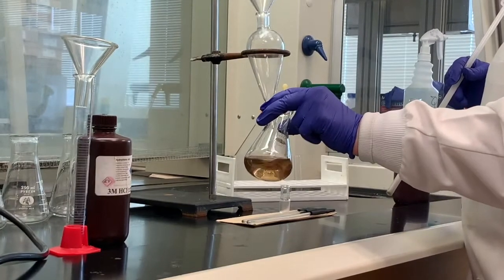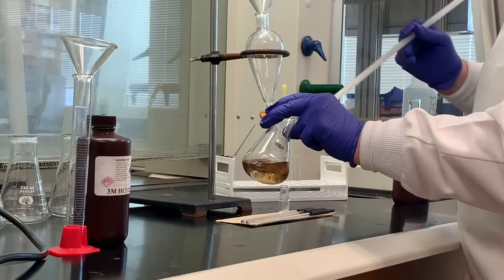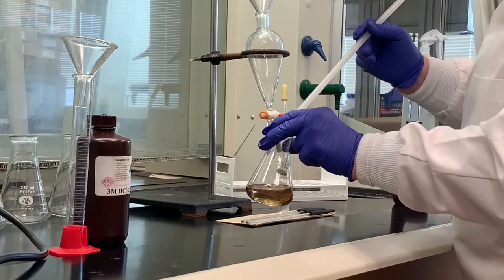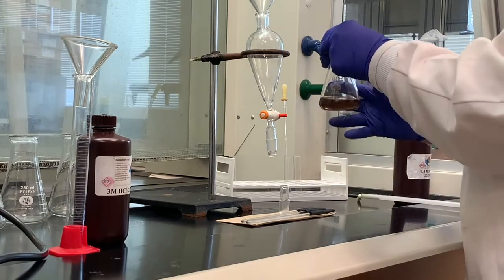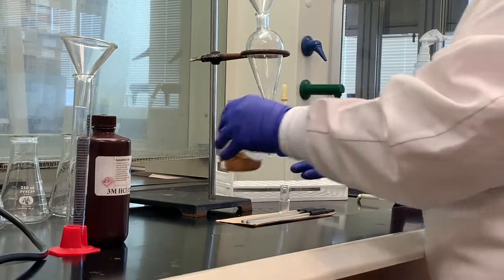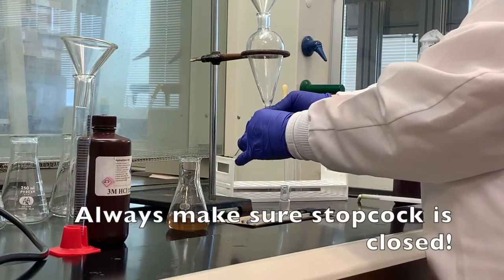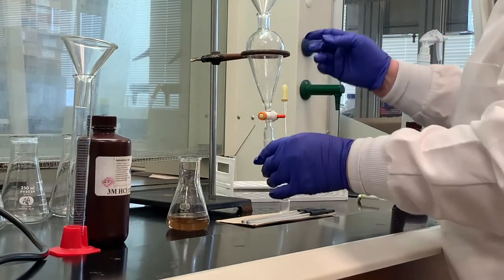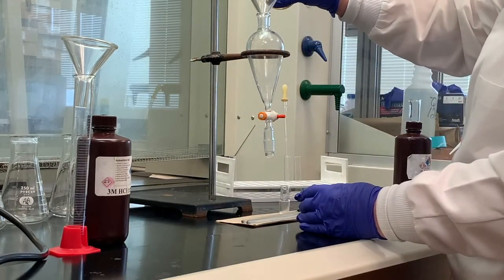All three components, organic solids, have dissolved in the dichloromethane. I'm going to remove the stir bar and set that aside. And then what I'm going to do is pour, but just want to make sure we go back. Always make sure that your stopcock is perpendicular. This is closed. I'm going to pour this mixture into the separatory funnel.